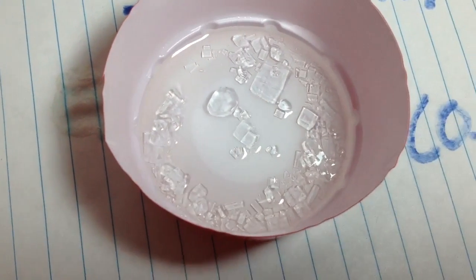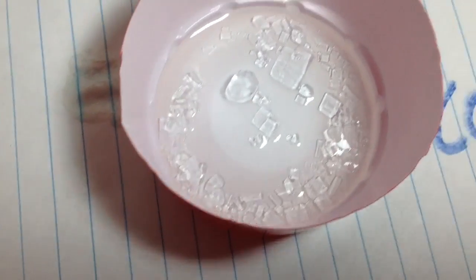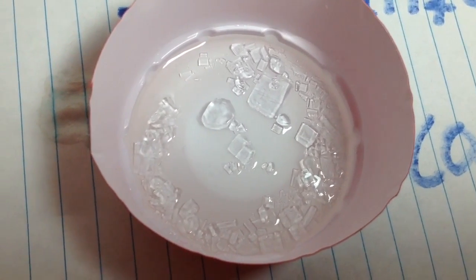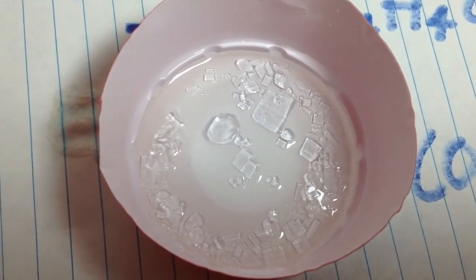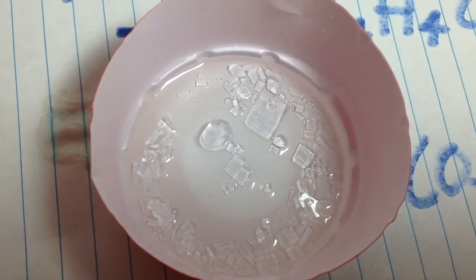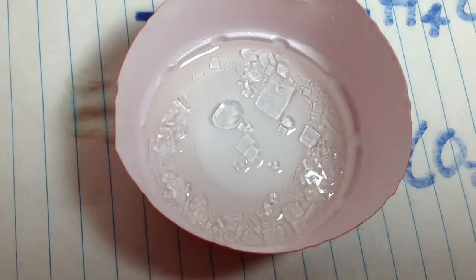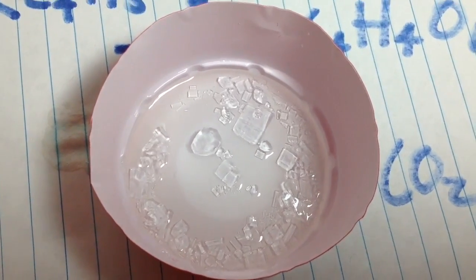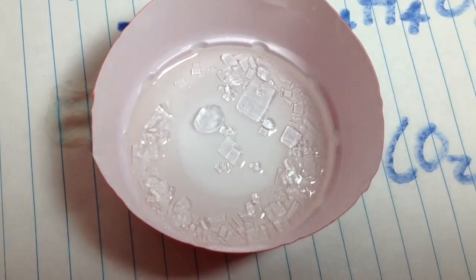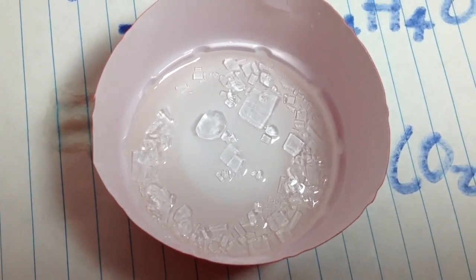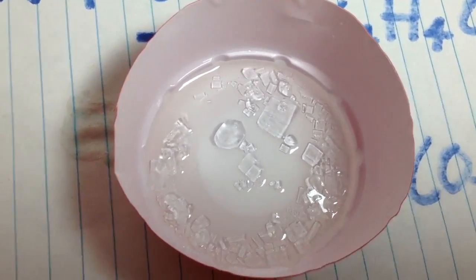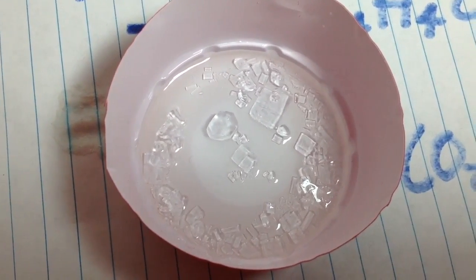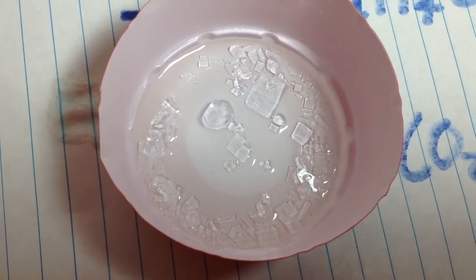The crystals have grown a lot since, and you can also see that they're very crowded. If you recognize some of these crystals from the previous clips, you can see that they're in different locations now because I jostled them around a little to make sure they're ready to filter. When should you harvest these? You should probably harvest these when crowding occurs. Right now you can see it's very crowded. You can reduce crowding by picking out the crystals by hand, but that is very tedious. So I prefer to harvest them all at once, and now is a pretty good time to harvest.